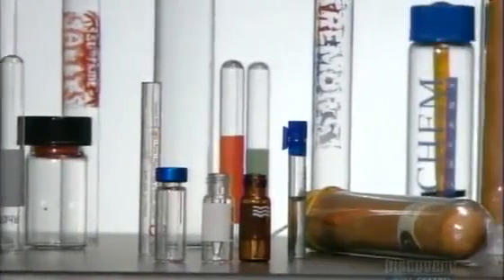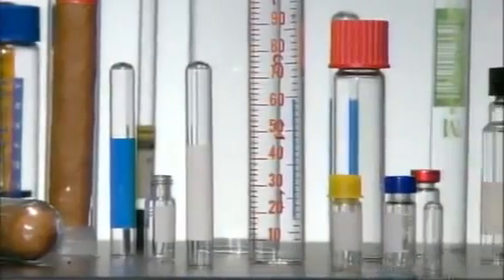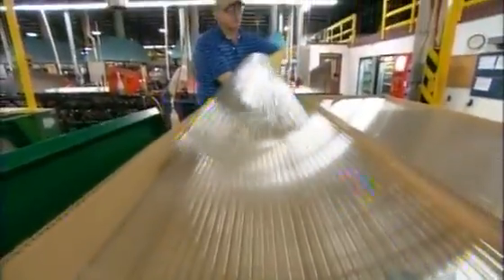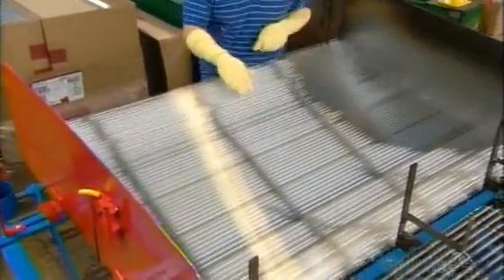Many scientific breakthroughs are born here, inside laboratory glassware, the tubes scientists use to hold liquid samples for chemical experiments. They start off as thin glass tubing, stacked by size, weight, length, and diameter. Workers select the correct size for the culture tubes they're making and place them in a magazine.